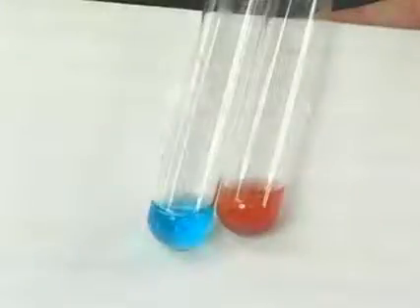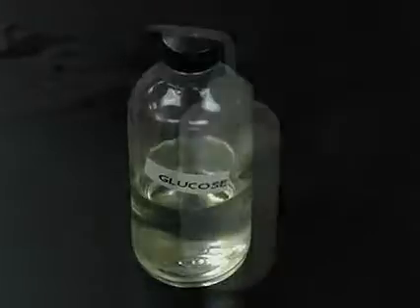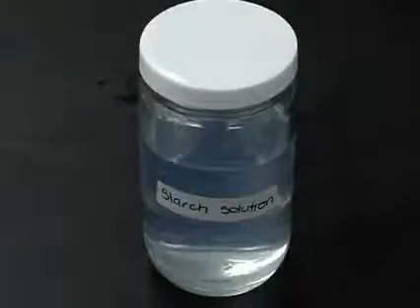The original pale blue color means no reducing sugar. A green precipitate means relatively little sugar, and a brown or red precipitate means progressively more sugar is present. Depending upon the concentration of sugar, we get a range of color in our positive results. For this test, the test solution will be glucose solution, while DI water and starch will be used as negative controls.